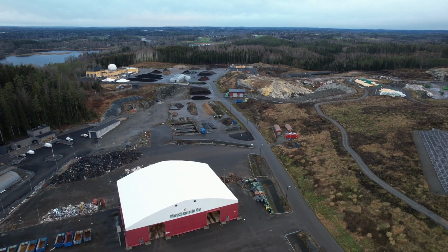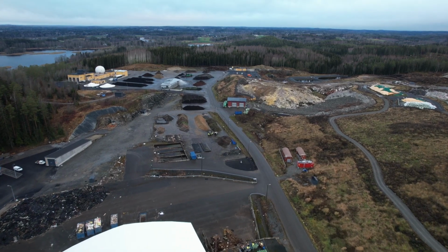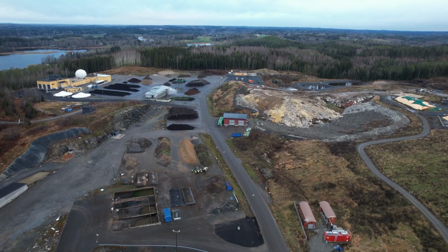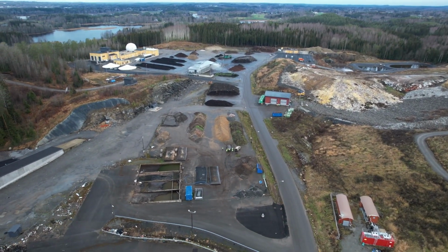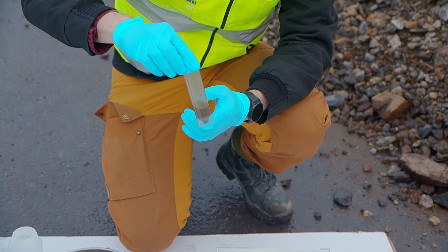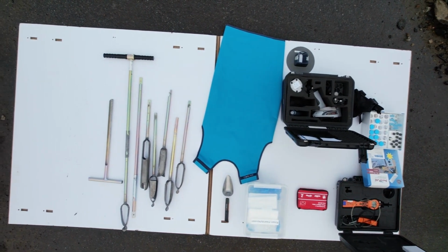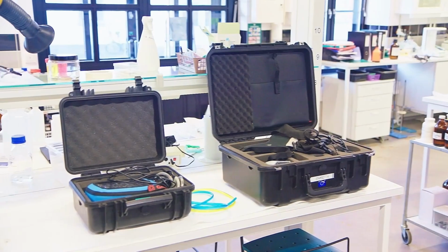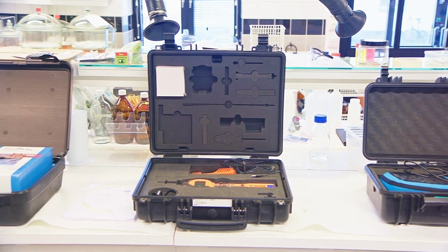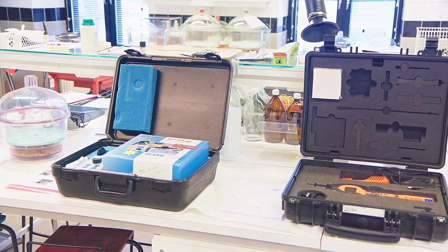The properties of the target contaminants should also be examined when considering the order. For example, volatile compounds should always be sampled and fixated first, because they volatilize quickly. In some cases, assays should also be done directly in the field. Soil samples can also be analyzed directly on the site using field meters and analyzers. Some meters only provide general suggestive mean results, whereas others provide more accurate contaminant-specific results. The suitability of the meters for the target site should always be considered case by case and based on the aim.